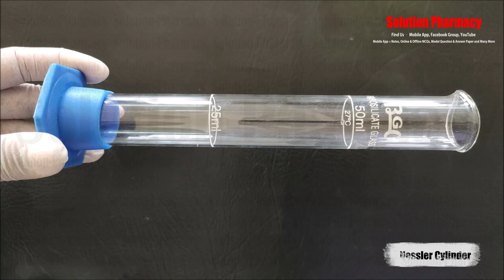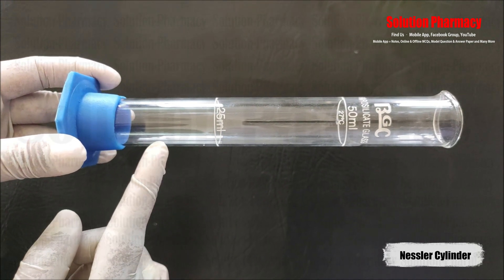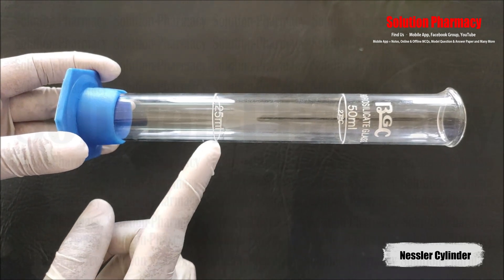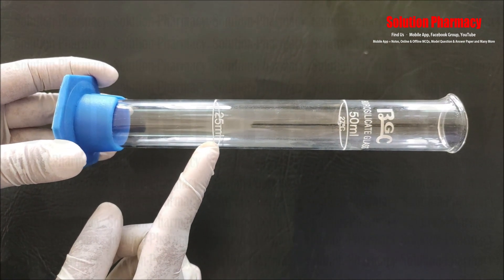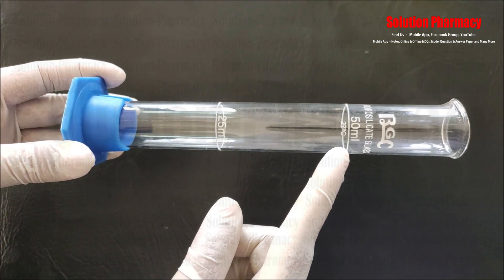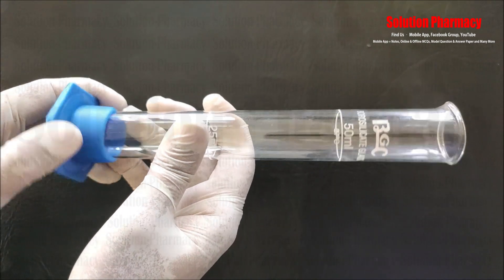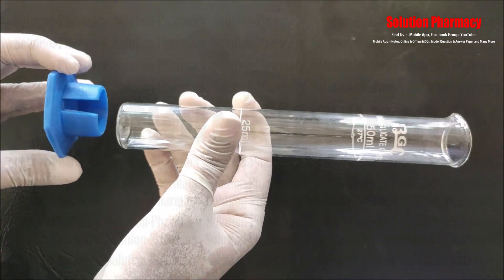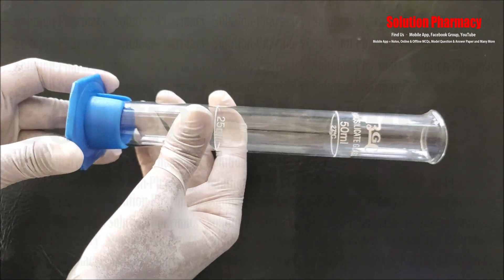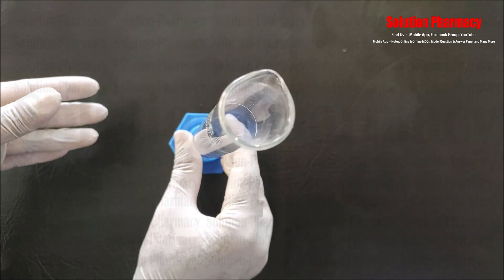Next, this is called a Nessler cylinder with a fixed volume, made up of borosilicate glass. There are two volume markings: 25 ml and 50 ml. This is the stand of the Nessler cylinder, which we can attach to keep the cylinder in a standing position at the time of the experiment.